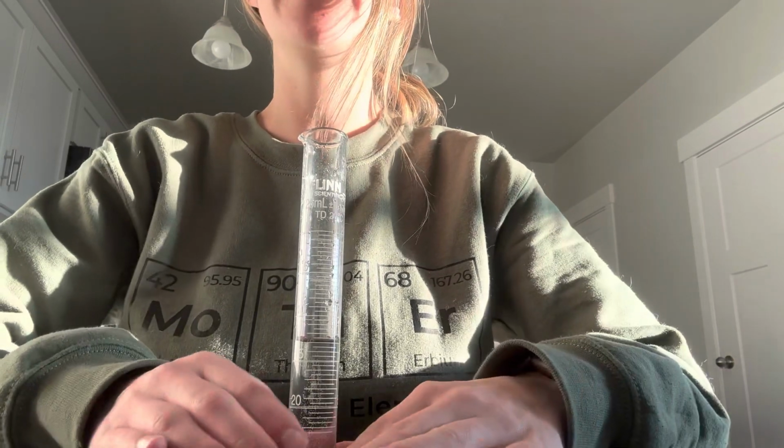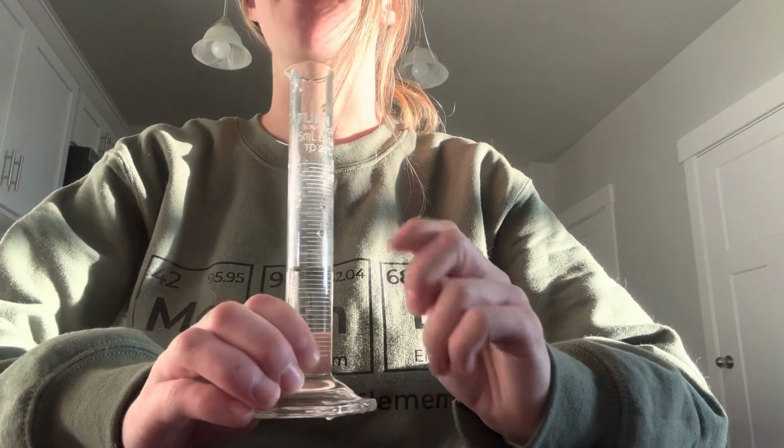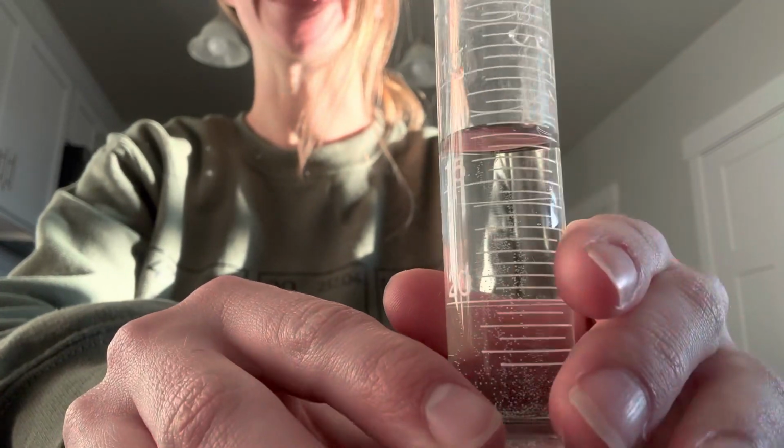All right, so one important thing when doing this lab is knowing how to read one of these graduated cylinders. So I'm going to show you how to do that the best I can on this video. So make sure you watch my explanation, even if it doesn't quite make sense, listen to it. So what you want to do when you are reading a graduated cylinder is you first want to make sure that you're eye level with it. So you want to get down, make sure you're on eye level. I'm trying the best I can to get eye level with the camera so we can do a practice problem.